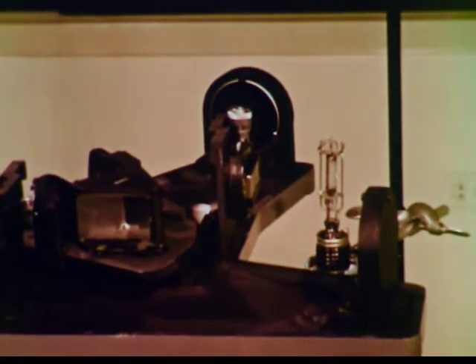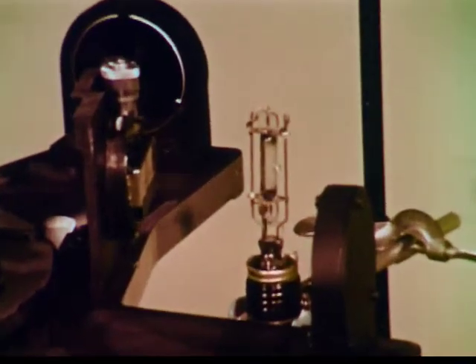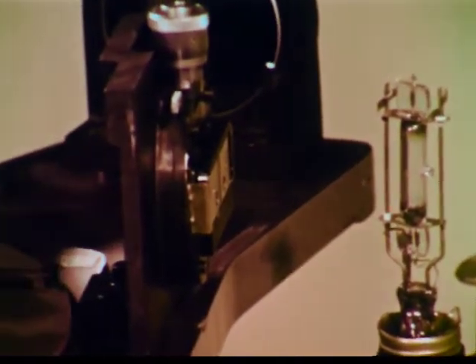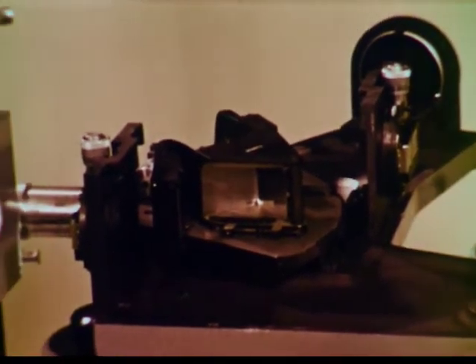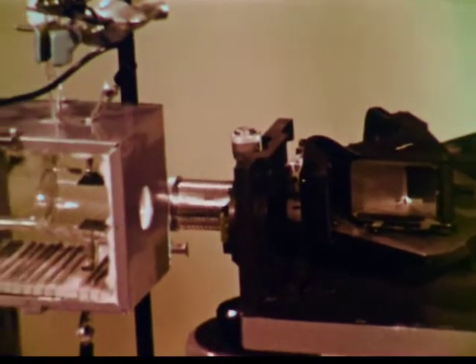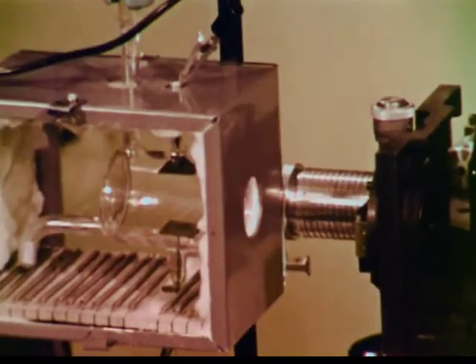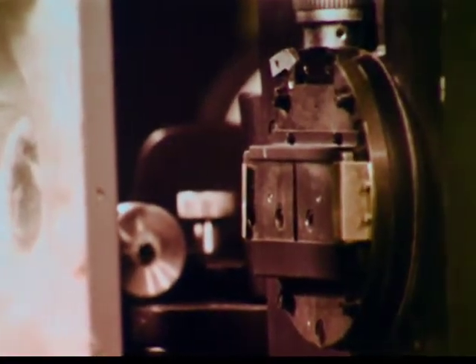For this experiment, the source of energy used to ionize the gas will be light from a mercury lamp. The light is directed by a series of mirrors through a quartz prism. Then it enters the cell, where it may be absorbed by gas atoms to form ions. All the light that enters the cell must pass through this slit, which admits only a single frequency at a time.